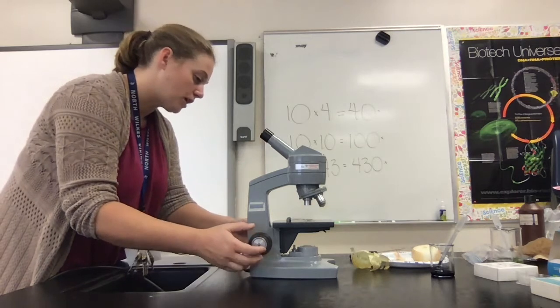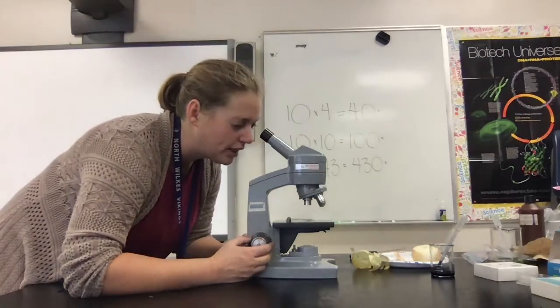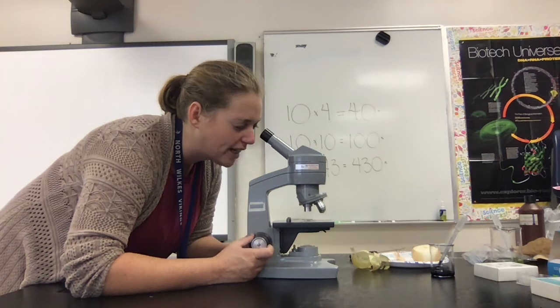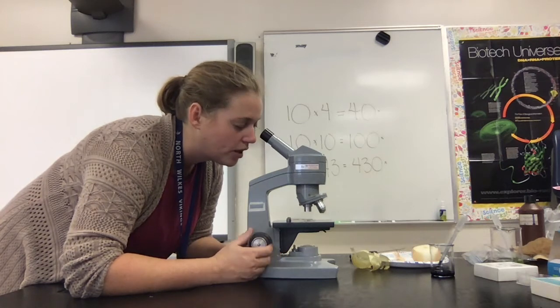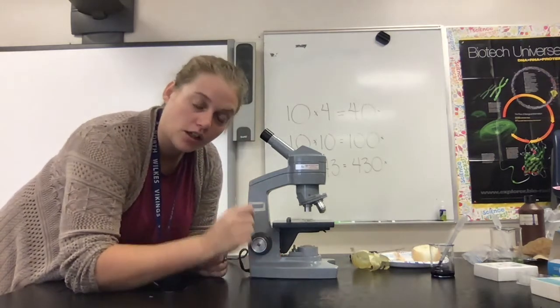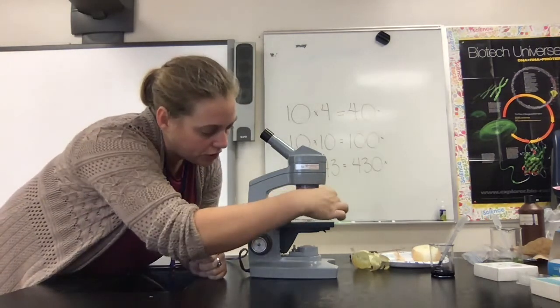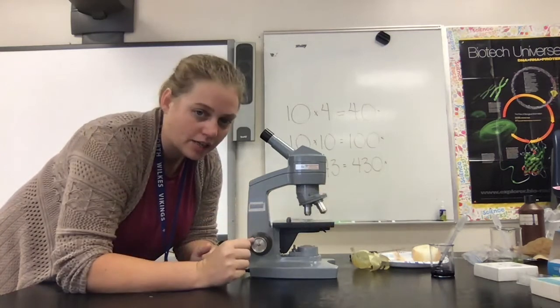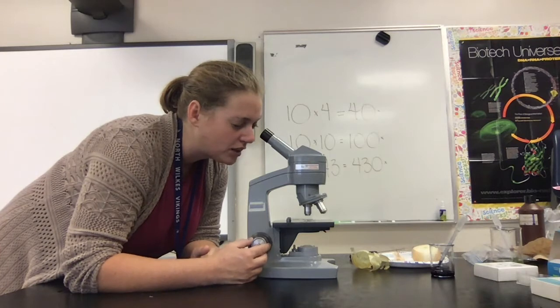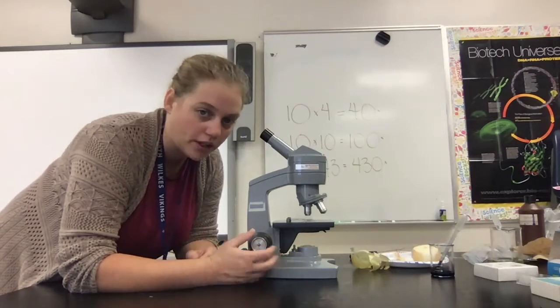To focus a microscope, start with the lowest power with the objective far away from the stage. Look into the microscope and use the coarse knob to lower the objective toward the stage until you see detail. Once your specimen is focused, center it in your field of vision. Then switch your objective to the next highest power and look through the eyepiece, using the fine focus silver knob to toggle back and forth until you see detail there as well.